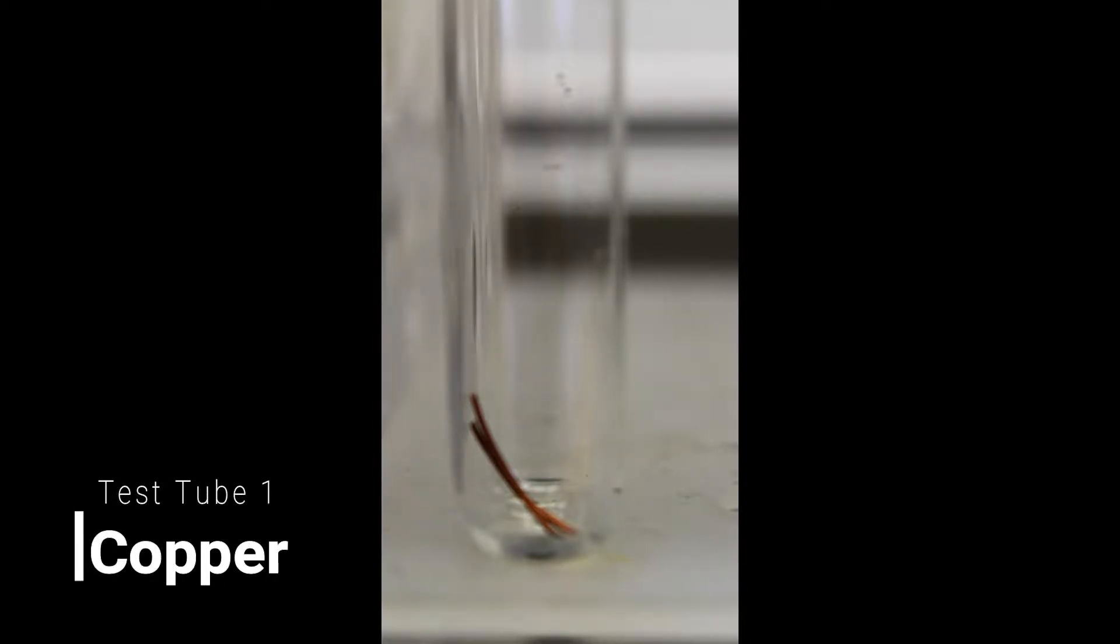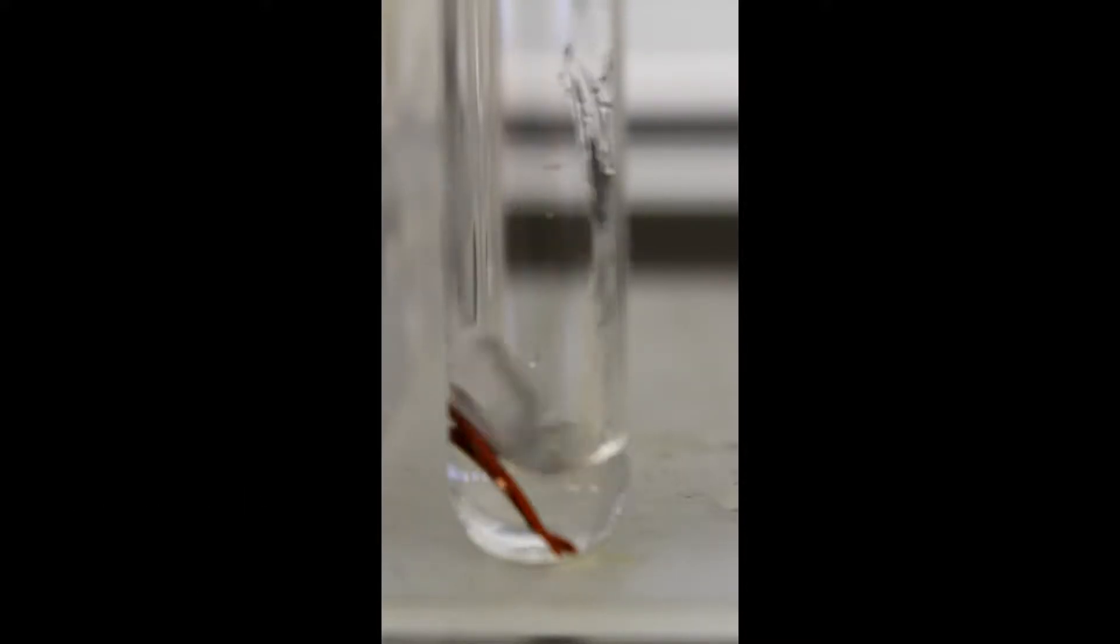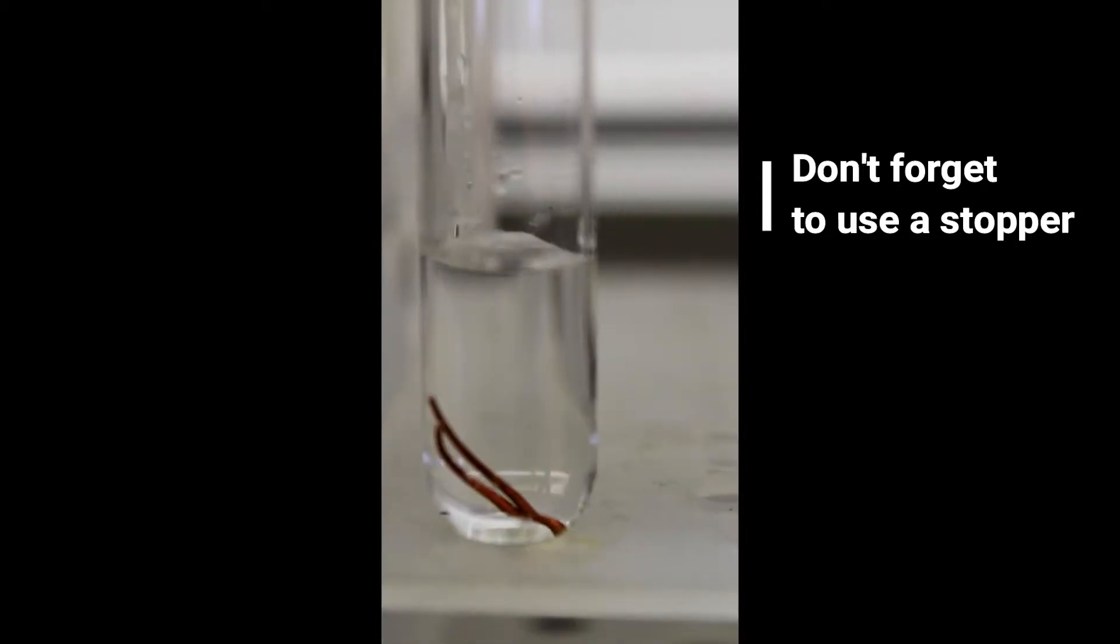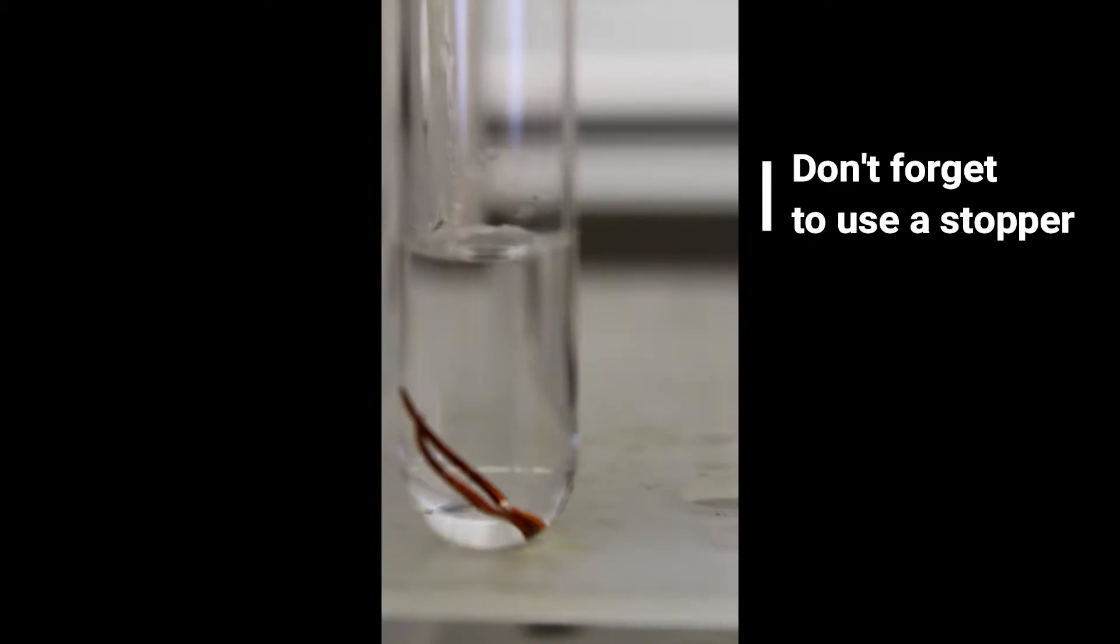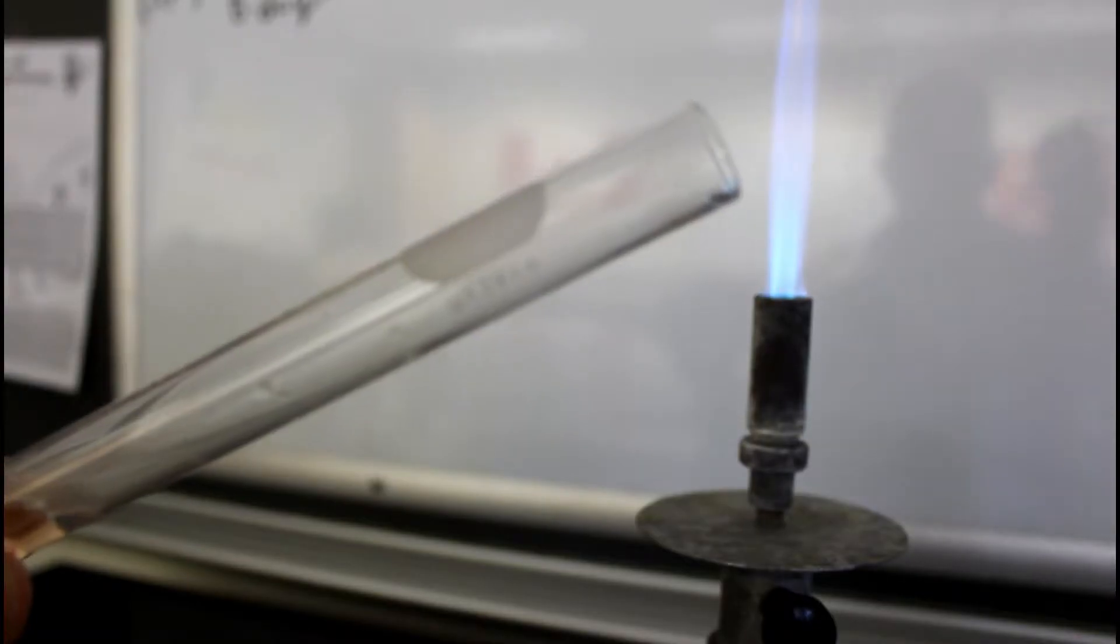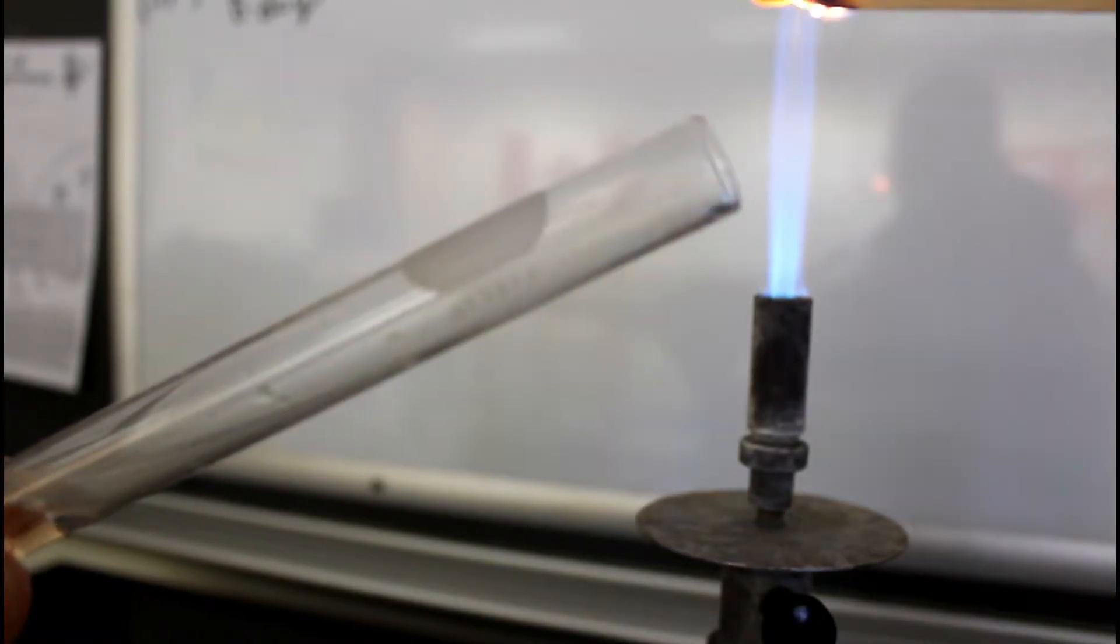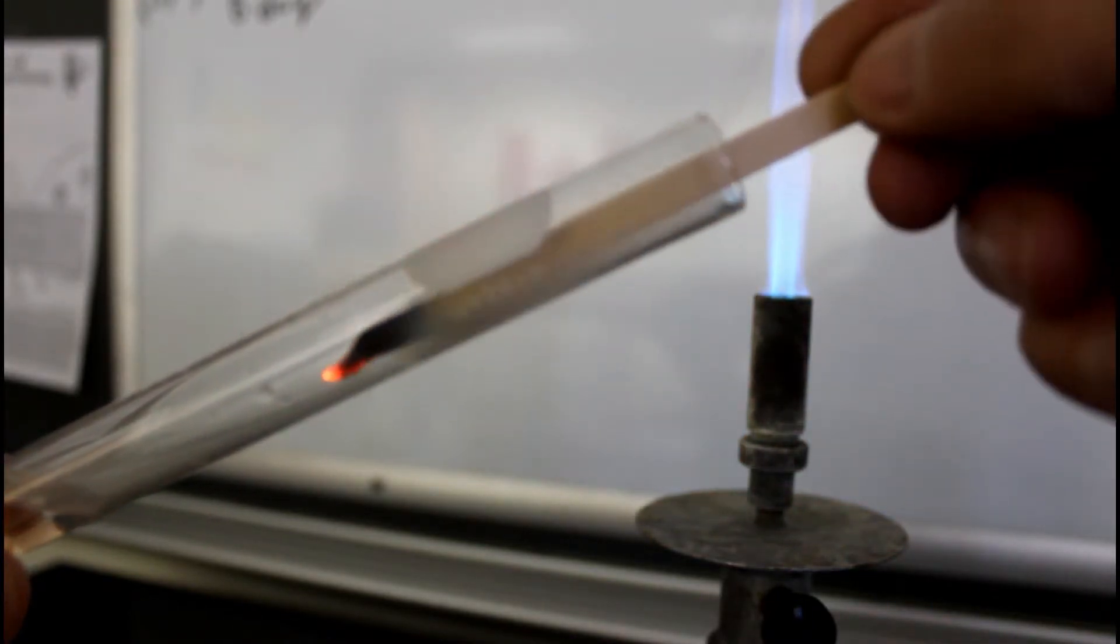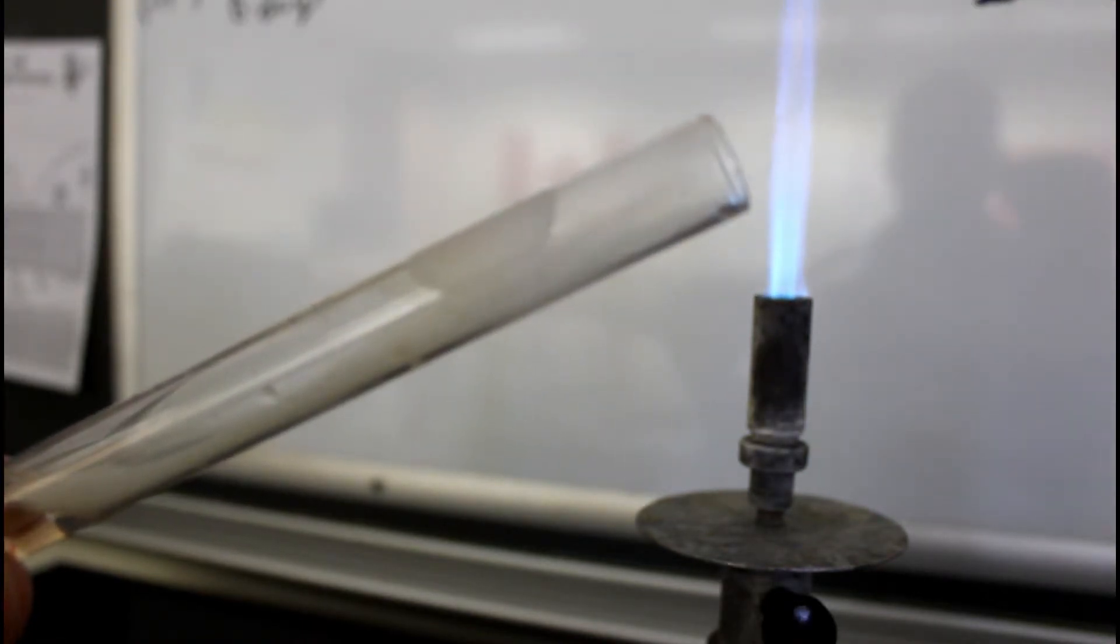Now we're going to add our four milliliters of hydrochloric acid. We see the flame went out. There's no reaction.